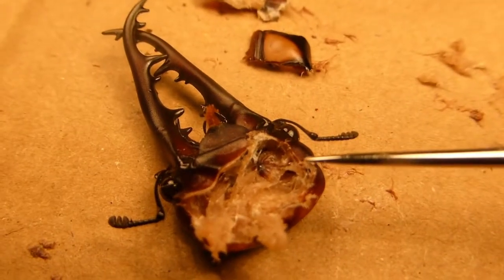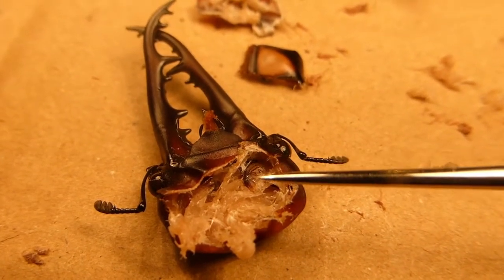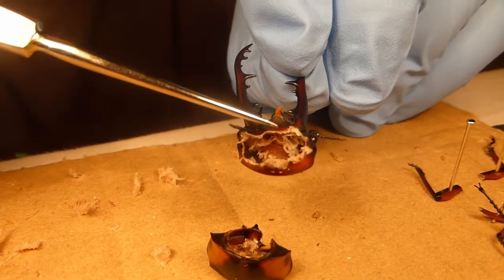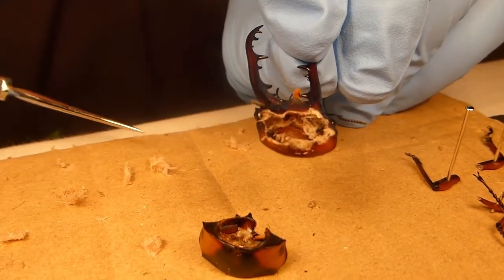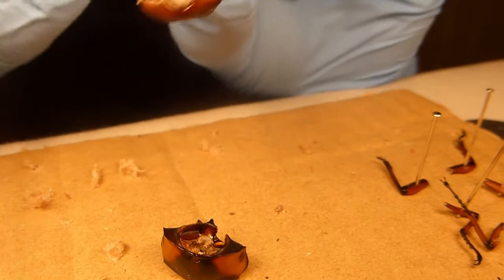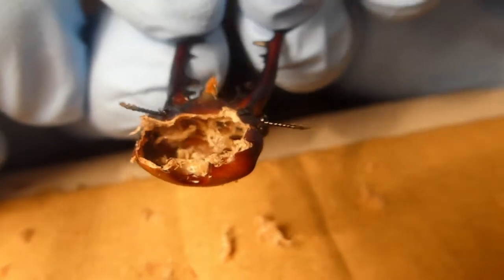I'm now showing you the inside of the beetle's head. You can see the eyes and antennae here. This dark structure down here is the insect's brain. I've removed the brain matter and digestive tract portions from the inside of the head — you can see some of the brain matter along here. The last thing I'm going to show you is just how these pincers work in the joint attachments — if I move those, you can see how the joints work on the inside of the head.